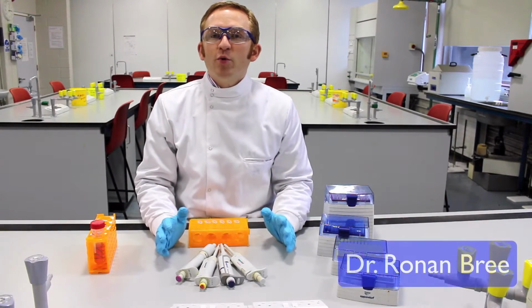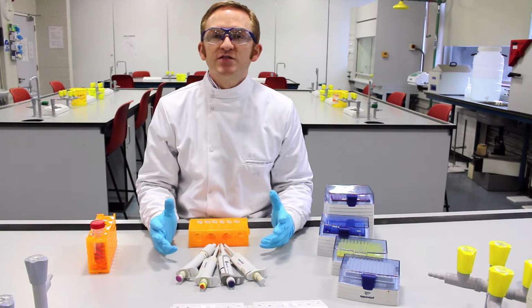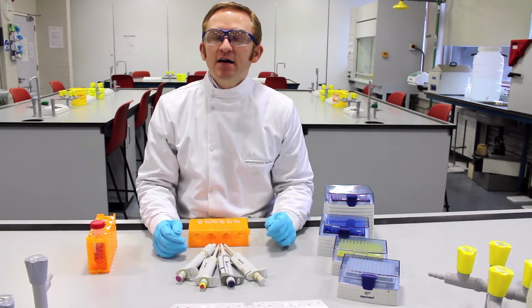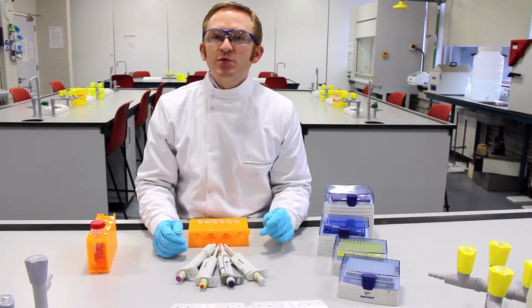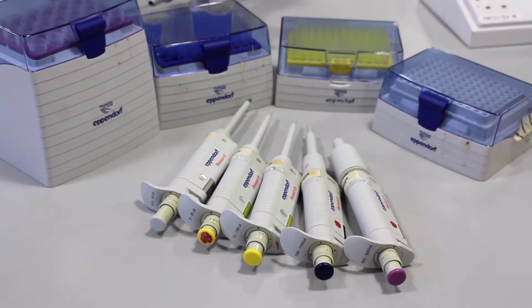In the lab, one of the most important things that you're going to perform is measuring of volumes, or measuring liquids or solutions or even reagents. And it's critical that you get this correct. I know from previous years you have huge expertise with pipettes and burettes and so on, but now we're talking about such small volumes that we really need to use autopipettes.